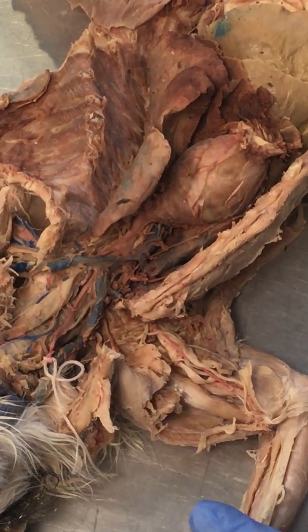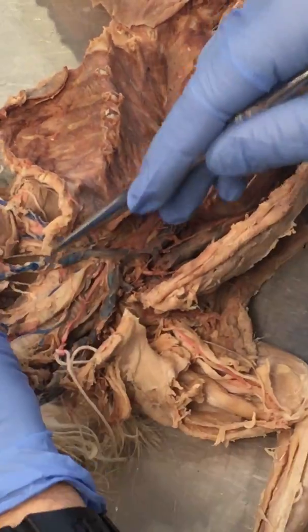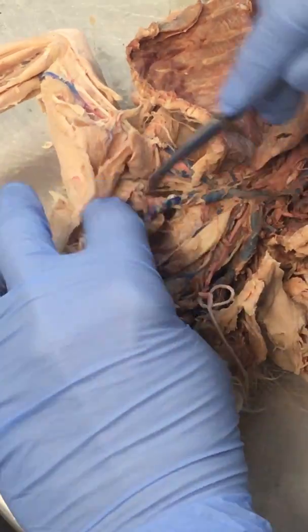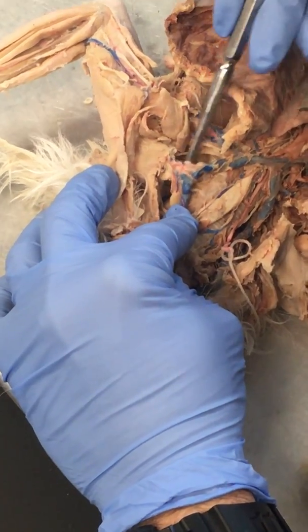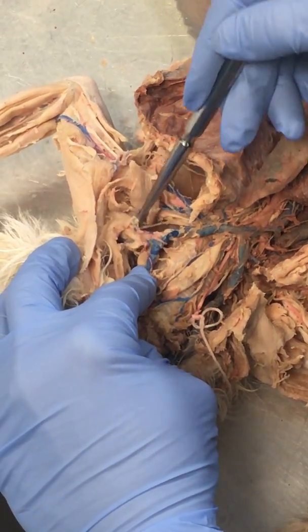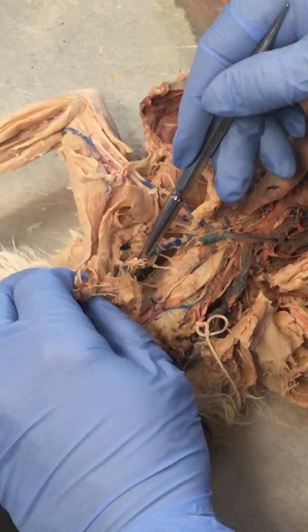We're not going to worry about costocervical trunks. You can scratch that off. Sometimes we can find thyrocervical. So thyrocervical is, now this is actually external jugular coming up. Thyrocervical is usually going to send a branch, this is more the vein side, over to the transverse, this would be like suprascapular and transverse cervical over here. And then there's usually a branch that comes off that goes up to the thyroid gland.